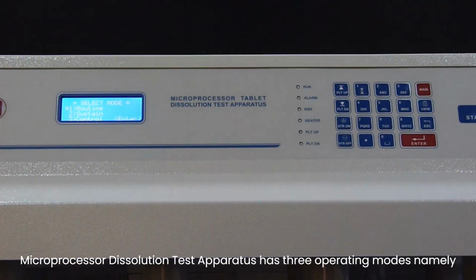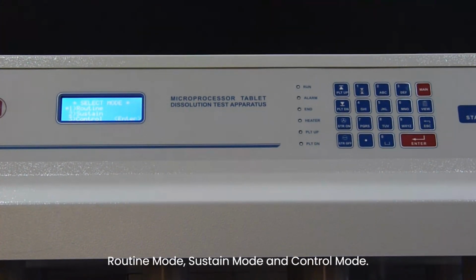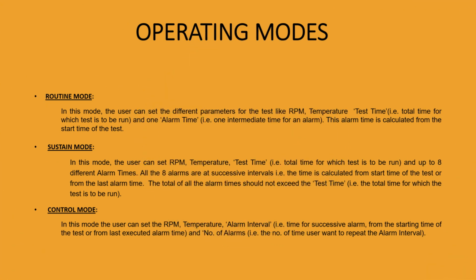Microprocessor Dissolution Test Apparatus has 3 operating modes, namely Routine Mode, Sustain Mode and Control Mode. The different operation modes are explained in the following chart. The user can store up to 20 different test methods using routine and sustain modes setups and one control setup in the instrument's battery backup memory.